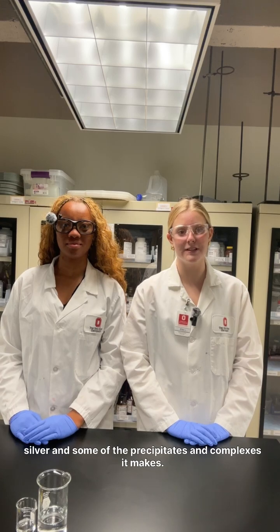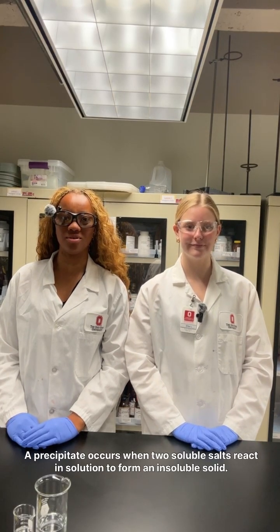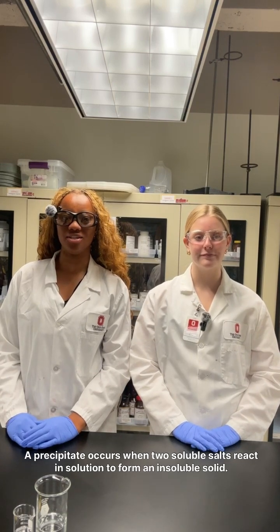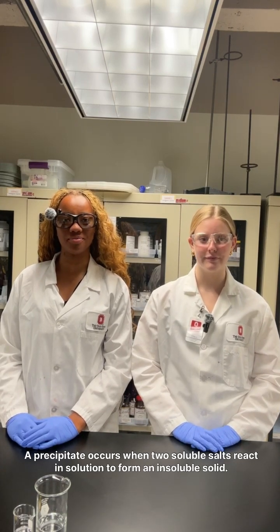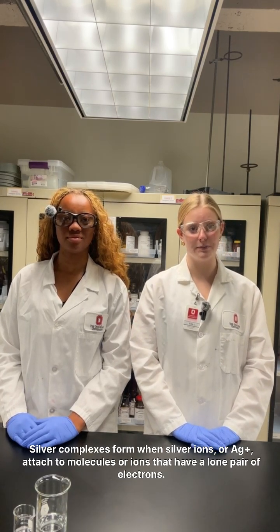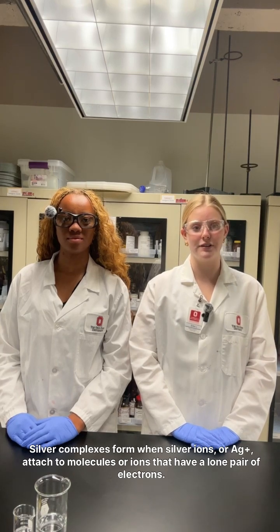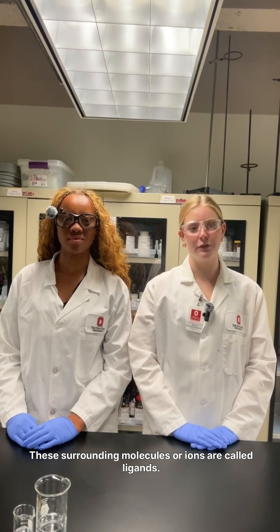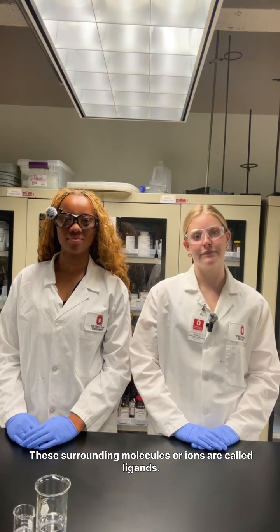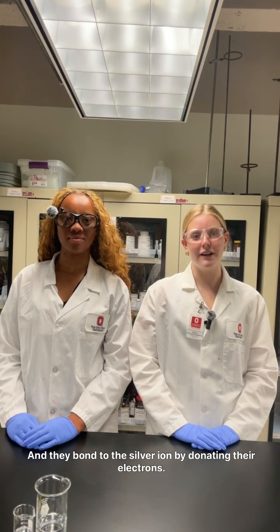Today we're going to be looking at the element silver and some of the precipitates and complexes it makes. A precipitate occurs when two soluble salts react in solution to form an insoluble solid. Silver complexes form when silver ions, or Ag+, attach to molecules or ions that have a lone pair of electrons. These surrounding molecules or ions are called ligands, and they bond to the silver ion by donating their electrons.